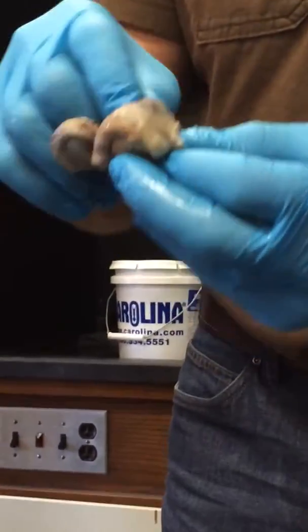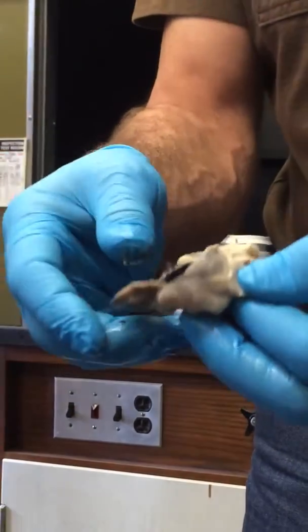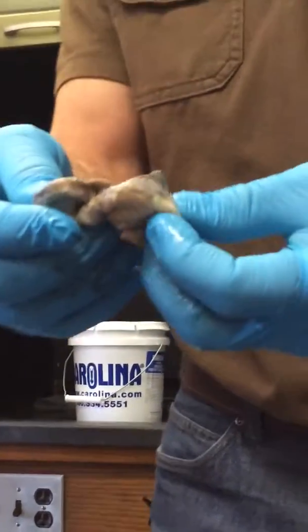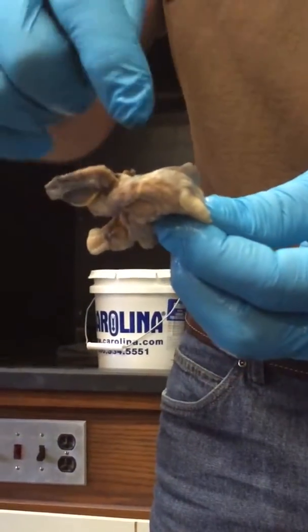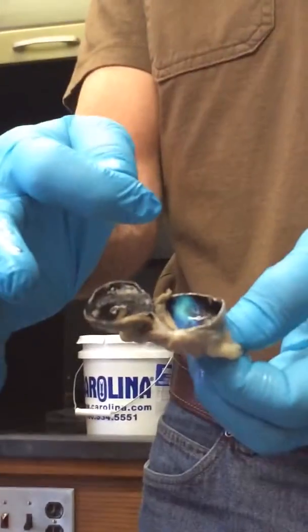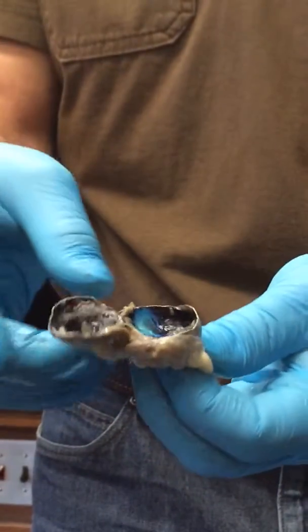And what is that point where the retina is very well attached? That's the terminus of the optic nerve in the back of the eye, and I guess we call that the optic disc, right, in the back of the eye. So that's where, in there. What lies between the retina and the sclera? The choroid. And the choroid in a lot of animals is pigmented like this.